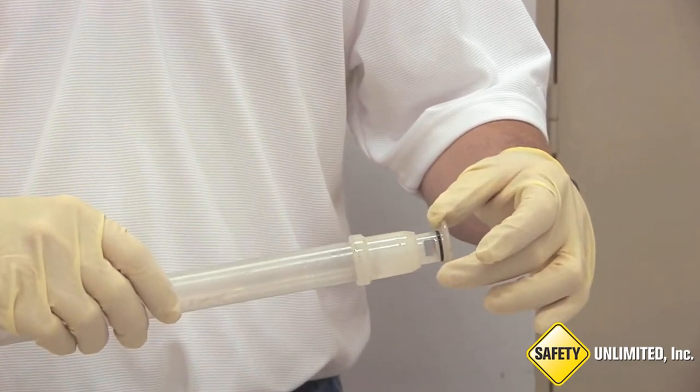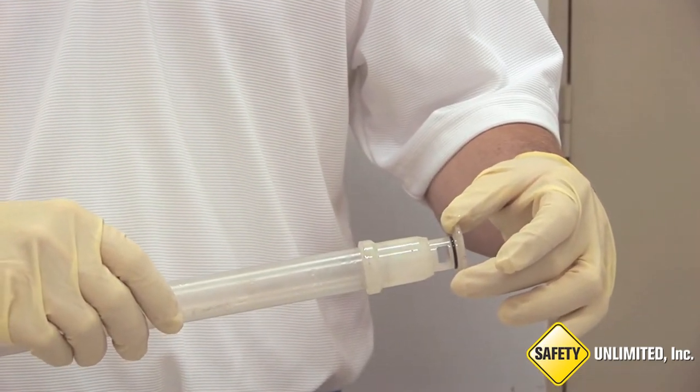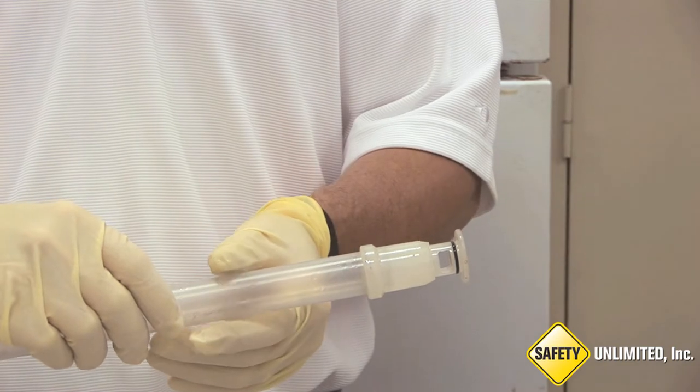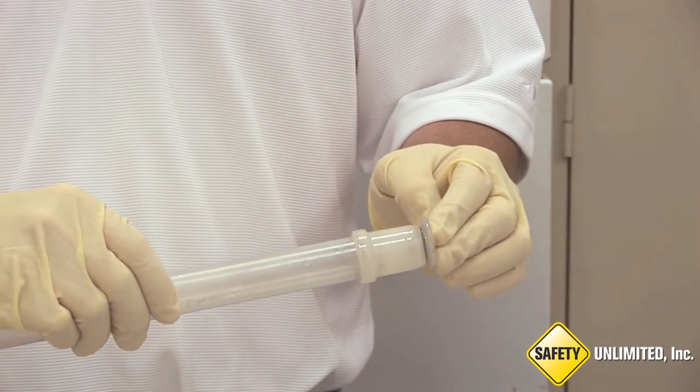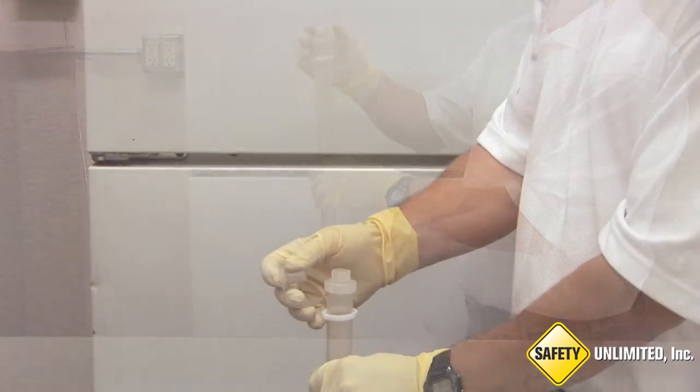The tube is lowered down into the drum and fills with liquid through this opening. After the tube fills with liquid, the bottom opening is closed by pushing the tube against the bottom of the drum.